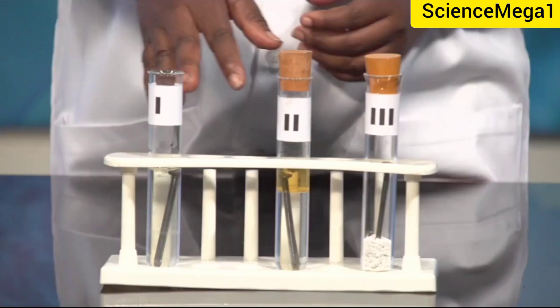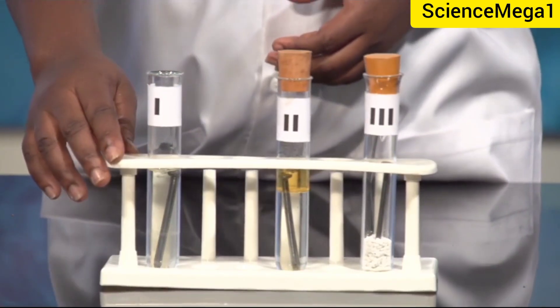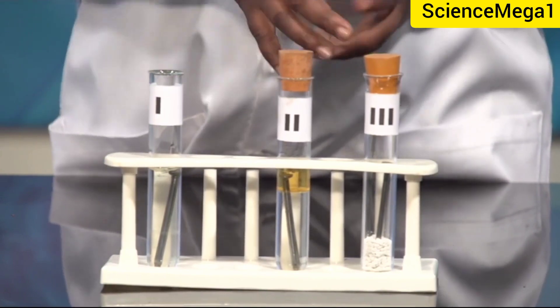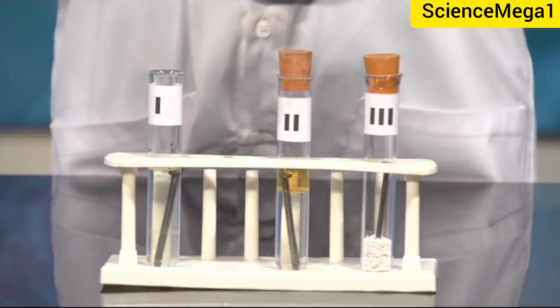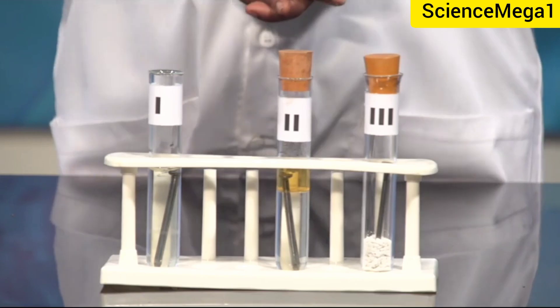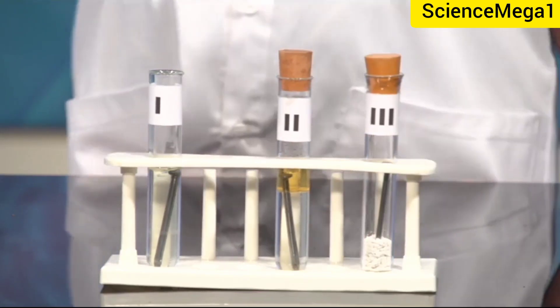The materials required for this activity: we have three boiling tubes, a test tube rack, corks, and three nails placed in three test tubes. In the third test tube we have a whitish substance which is calcium chloride.